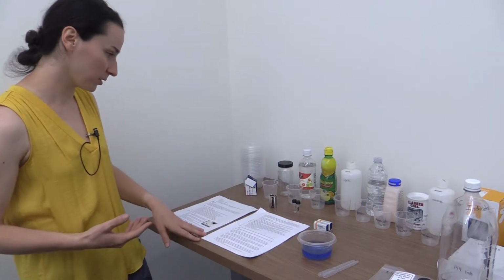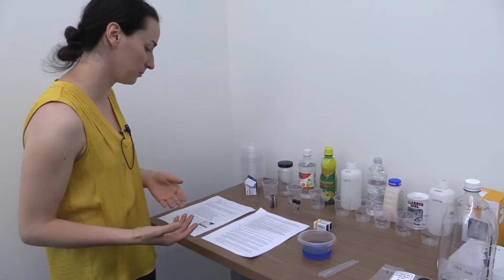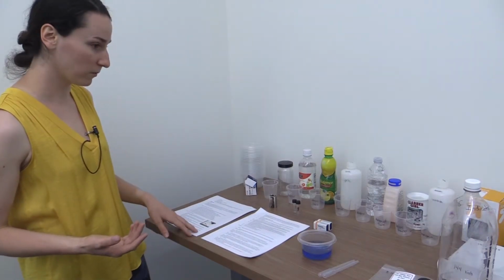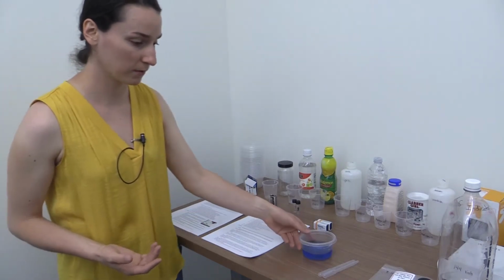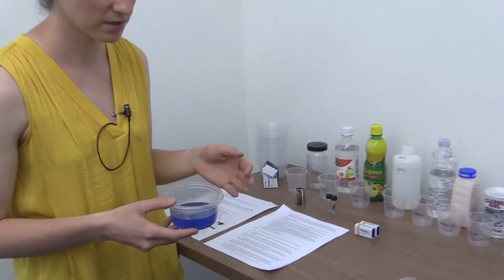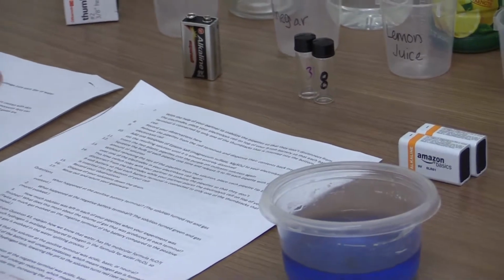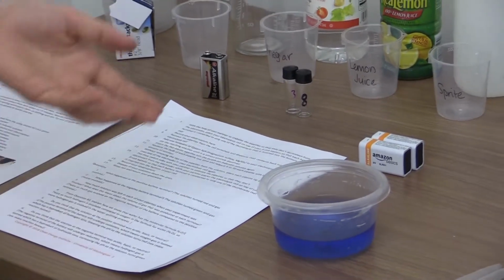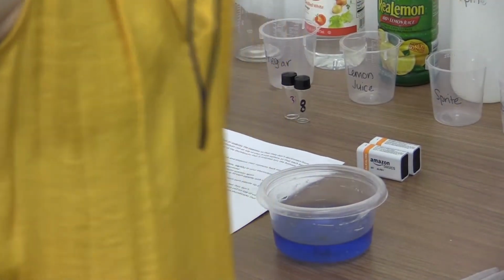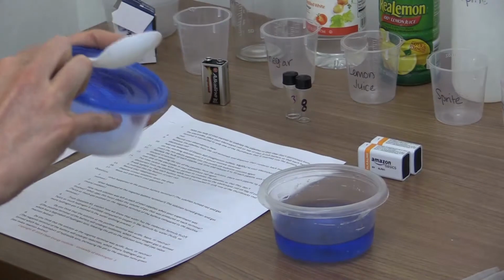The other thing that they're going to do after they've prepared all of their indicator solutions is run the electrolysis experiment. They're going to have their cabbage juice indicator, and you want to make sure that it actually has a decent amount of color in it. If there's not enough indicator solution in there, you won't be able to see the color change in the reaction. So you want it to be pretty bold when it's in their reaction containers, and then they need to add an electrolyte into their container in order to conduct the electrolysis and to move the charges from the battery.